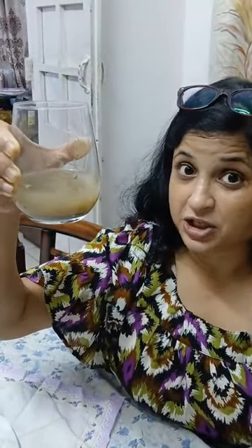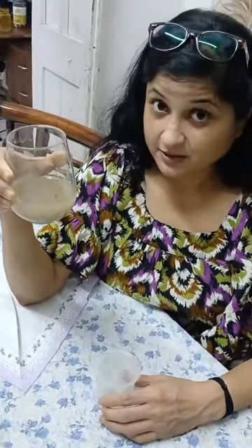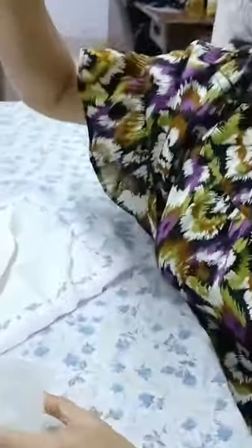So in sedimentation, the heavier particles, the mud, have settled down as the sediment, and we can purify this liquid, which is the top layer, with the method of decantation. Though decantation is not a pure method, it will not give us the pure liquid that we are trying to collect, it can give you some kind of purification. So let us see what decantation is.